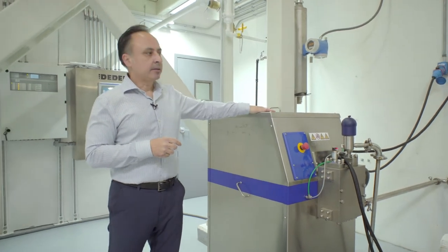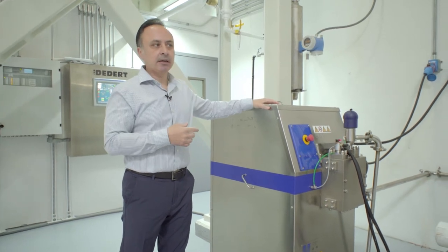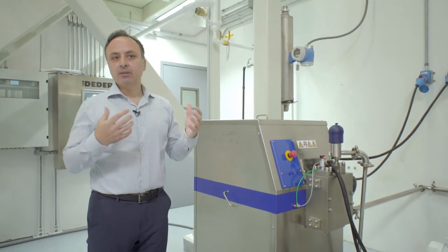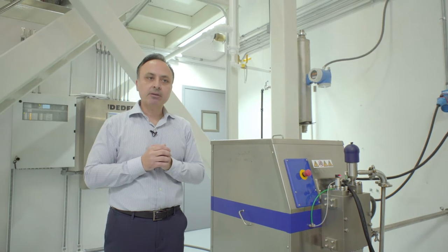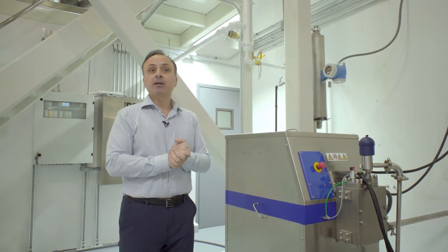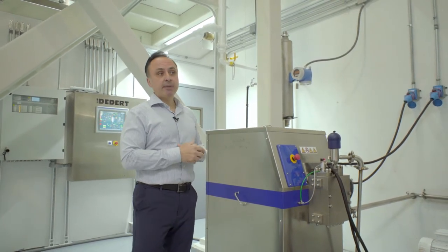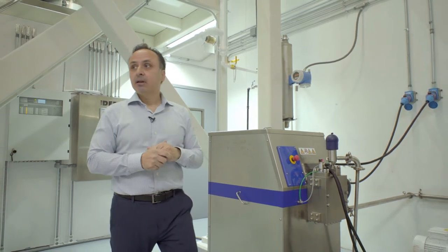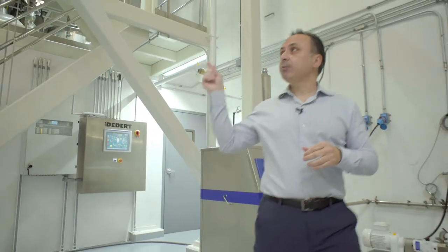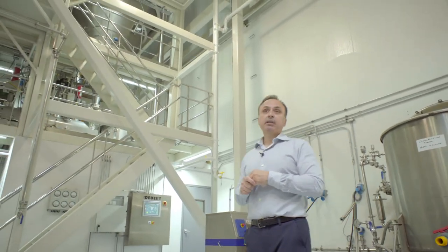What I'm showing you right here is a high-pressure nozzle and high-pressure pump. When we use nozzles to generate fine discrete particles, we use a high-pressure pump to force the liquid through and spray it into the chamber. Alternatively, we can use a rotating disc — called a rotating atomizer — to generate these discrete particles. We have many different ways to generate these particles. The three-meter chamber on top, which we're panning up to see, can also be multi-configurational.